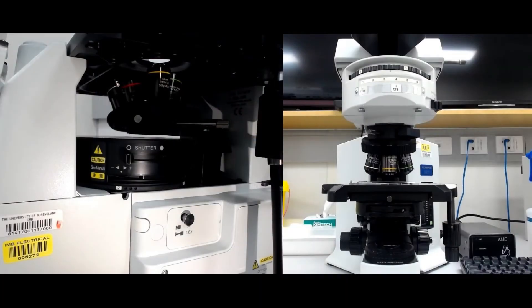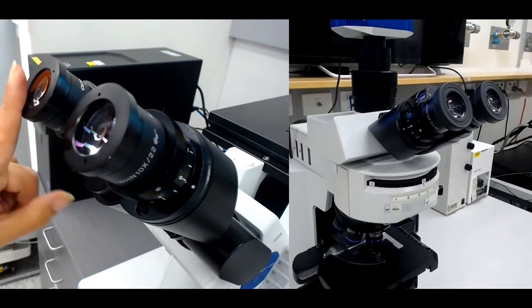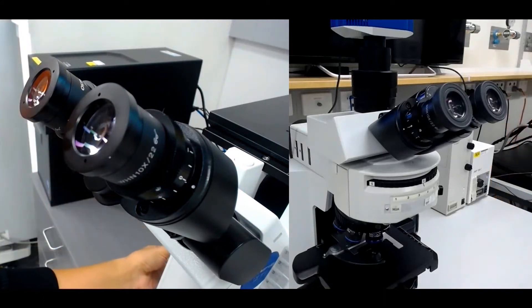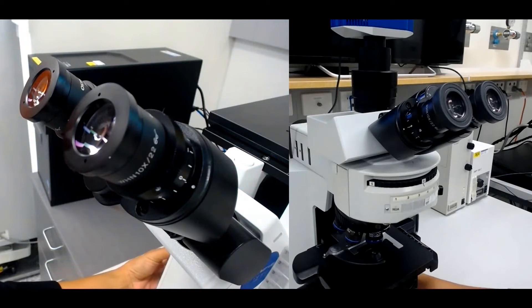Start with a low magnification objective such as the 4x or 10x and focus the image by just using one eye. Use both the coarse and fine focus to obtain a crisp image.